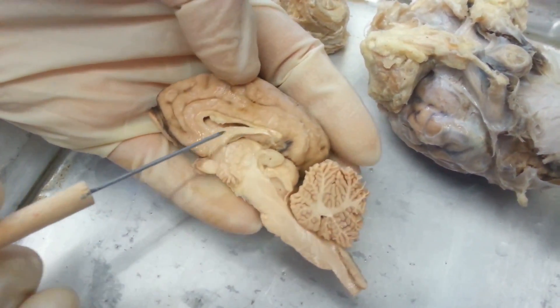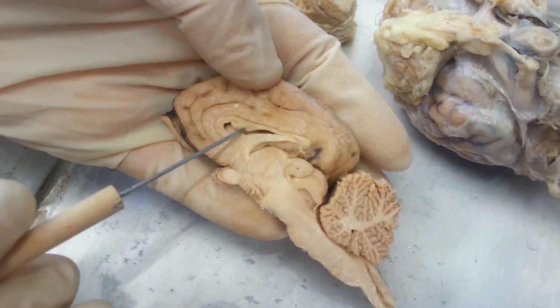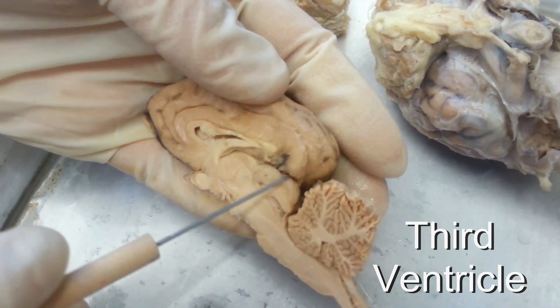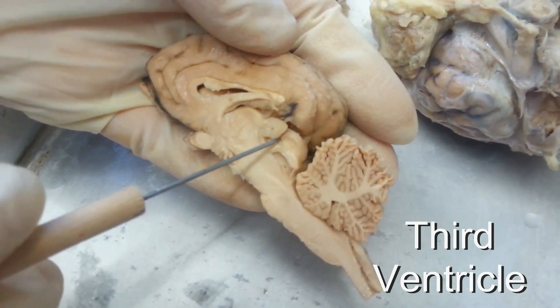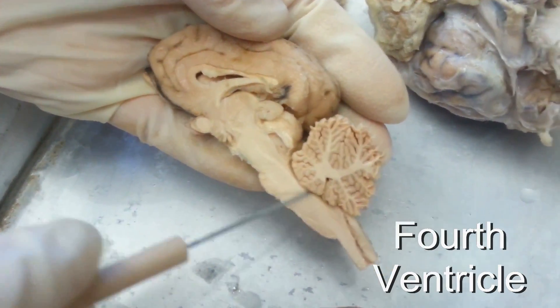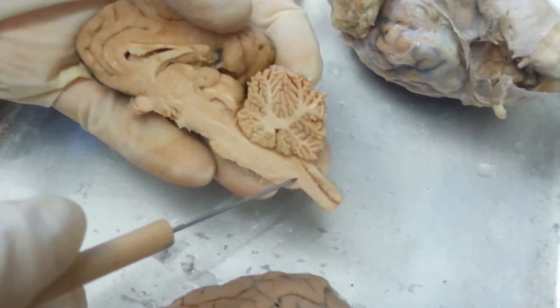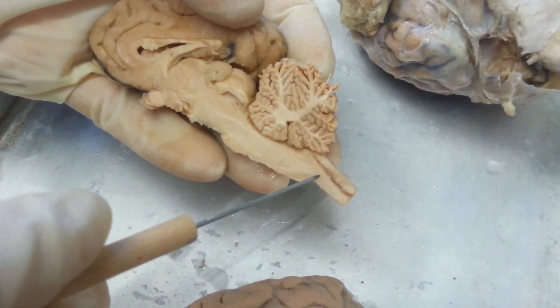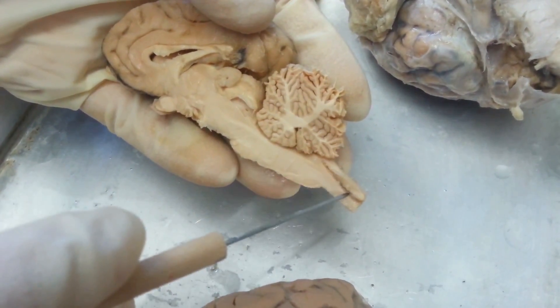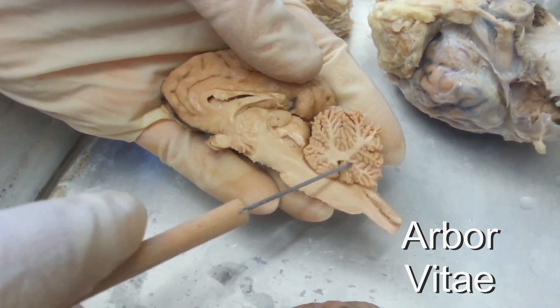There are spaces filled with fluid. What the septum pellucidum is separating are the two lateral ventricles. Then you have the third ventricle and the cerebral aqueduct, which connects the third and fourth ventricle. Once you get to the spinal cord after the medulla, this is the central canal. This structure that looks like a tree is called the arbor vitae — it looks like branches.